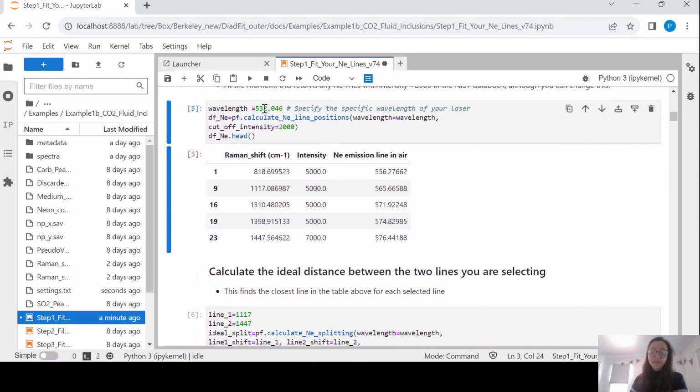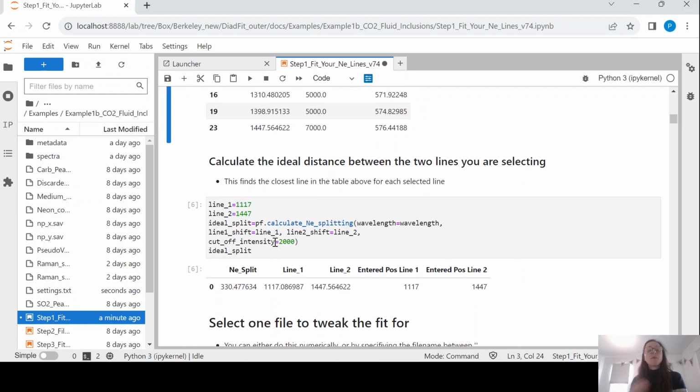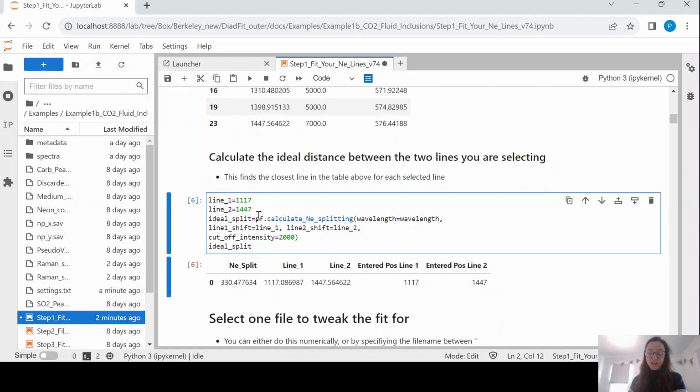So we see for this wavelength, this is what we use at Berkeley. The neon line emission in air has this value, and the Raman shift is over here. You're then going to pick 2 lines. This is conventionally how this is done. There are various criticisms of this that we discuss in the DiadFit paper. We find it works pretty well as long as you always choose the same lines for calibration and running. So we're going to use the 1117 and the 1447 line.